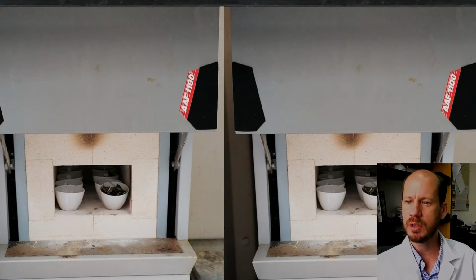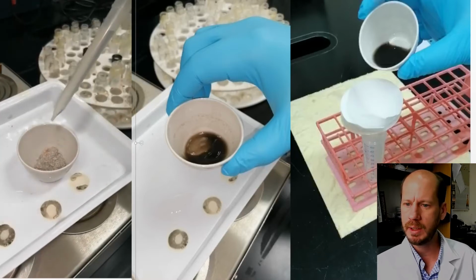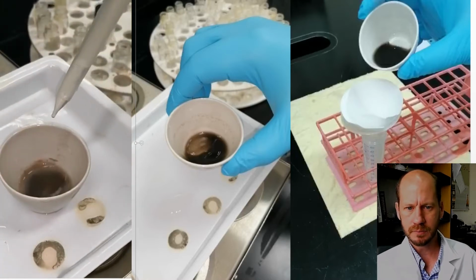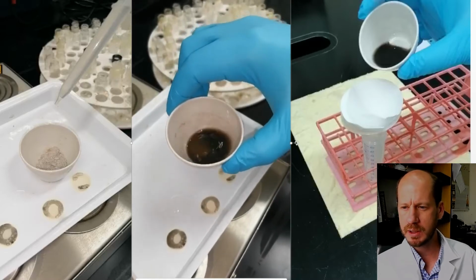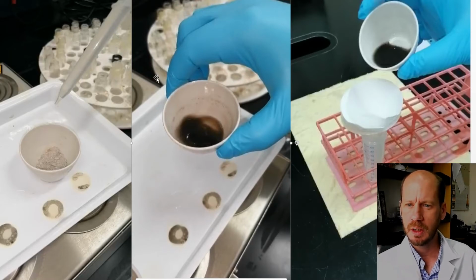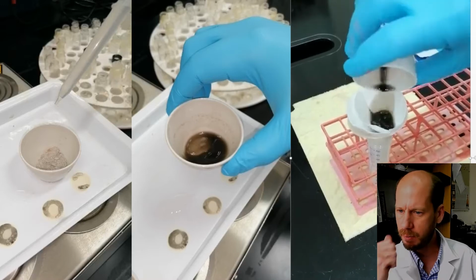And then we proceed to dissolve the ashes on acid. Okay, so this is how it looks like. This first video here is Lilwa adding acid to the ashes, in order to dissolve the phosphorus and the potassium on the ash material. The second video, just shaking around and mixing well, and then we leave it to rest under extraction fume hood. And after 1 hour, we filter this material up. So the filtrate is what we're going to analyze for phosphorus and potassium.